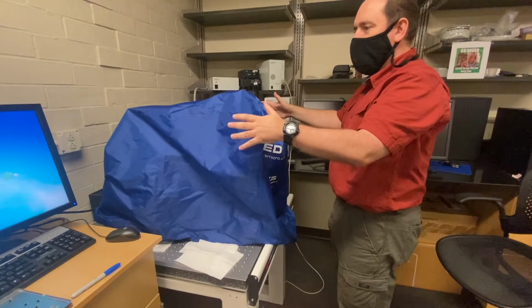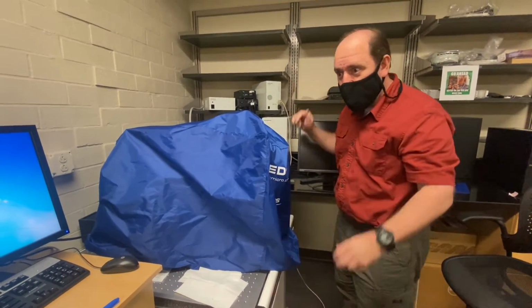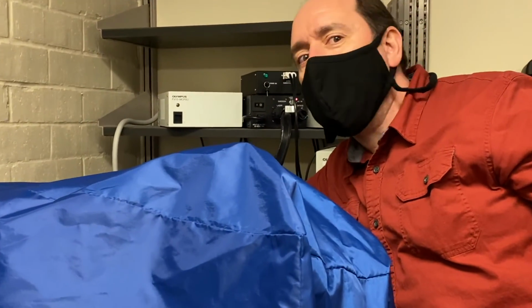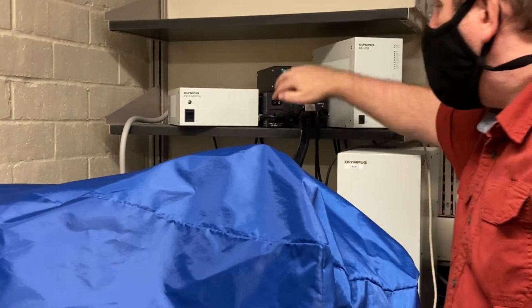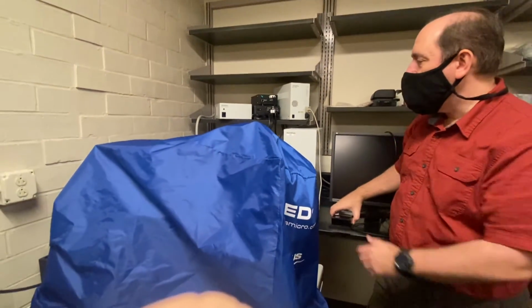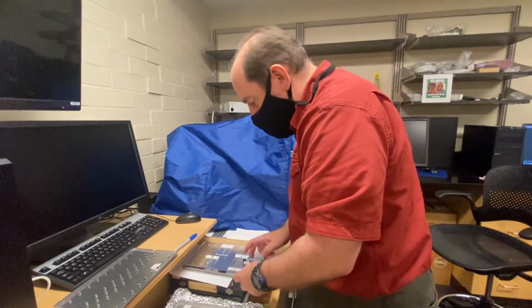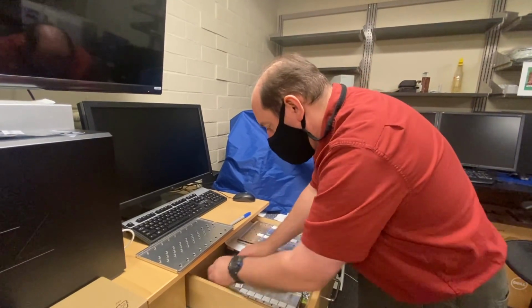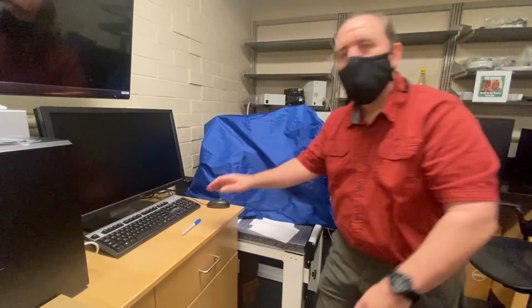So now the microscope is done, the computers are shut down. Why do I still hear a noise? I don't know if you can hear it in the camera or not. The fan is still on. Oh hey, that is so much cooler than it was just 5 minutes ago. And so now I'm going to go ahead and turn the fan off, put our slides away in a drawer where dust won't be falling on them. We often use this drawer right here as a central location for all our microscope slides. Extra racks for next time, and we're done for the day.